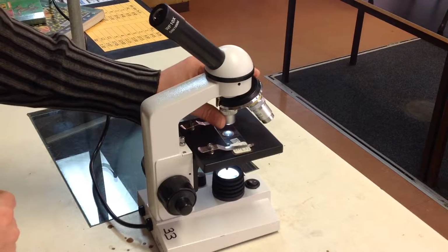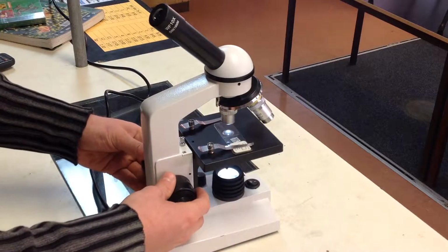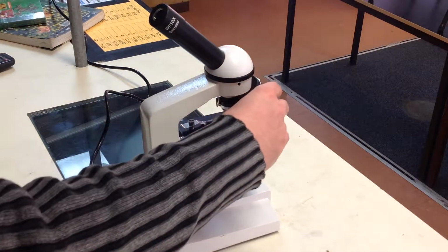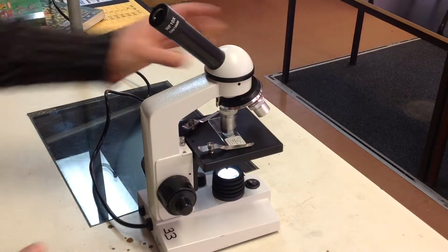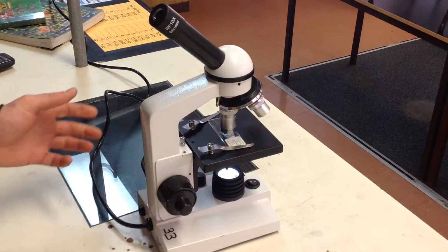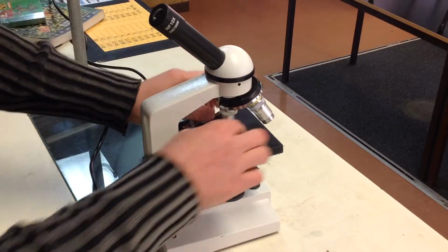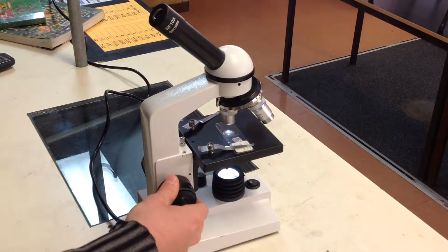Now, one other thing too, particularly if we move on now from the parts of the microscope to how we focus it, is we always start with the stage in the highest position. And that's to make sure that we don't crush a slide when we bring the stage up. As you can see, some of the bigger objective lenses actually hit the slide when we put them down. So if we're bringing the slide up to try and focus it, it can be quite easy to crush the slide with the lens. So we always make sure that we start with the lowest power objective lens when we're focusing an image on the microscope, and also we make sure that the stage is up as high as it will go.